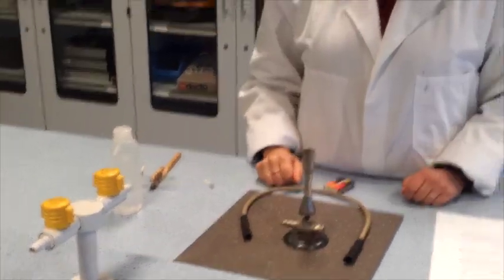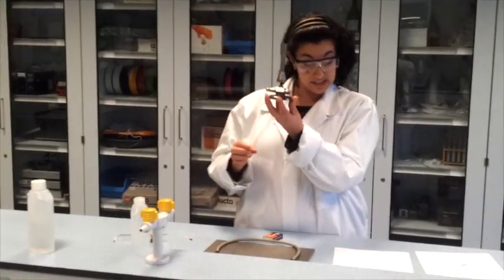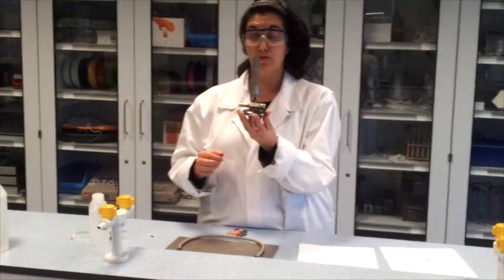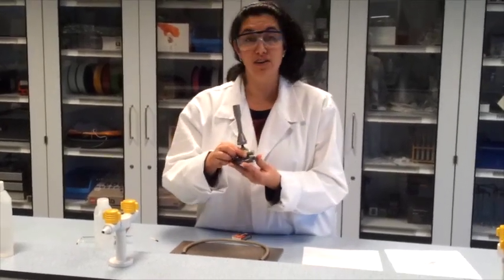And then we clean everything up. Now beware, the burner could be hot, so hold it by its base or leave it to cool down before transporting it. Thank you for listening and good luck with your practical.